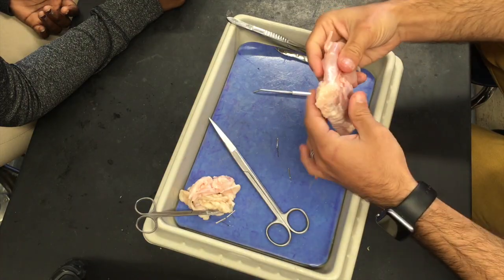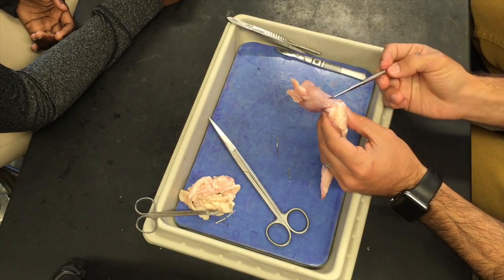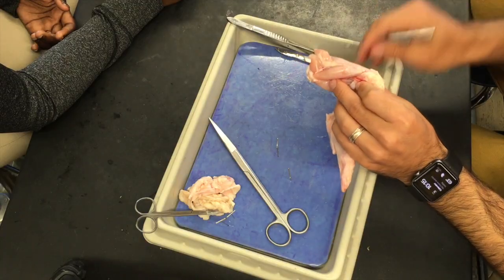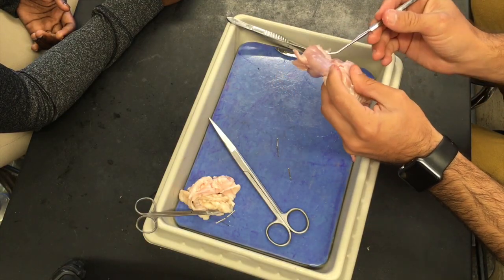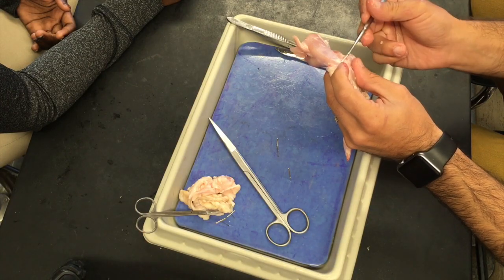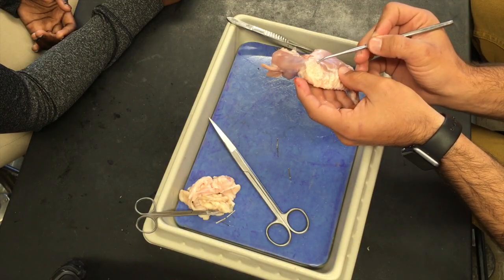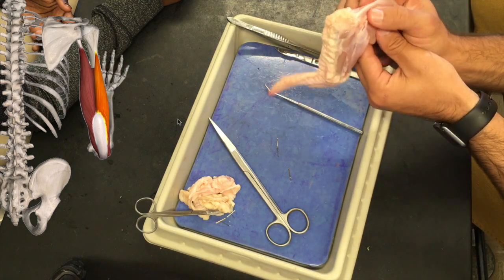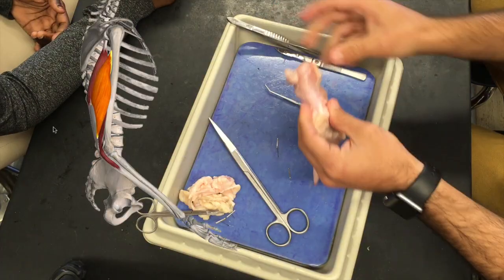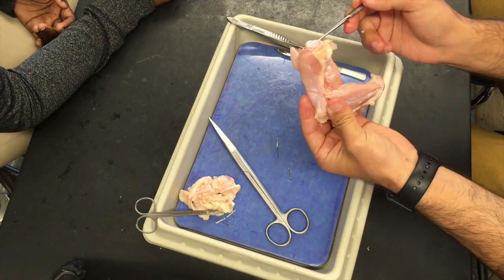Now we do the same thing on the tricep. How many muscles are in the tricep? Three. We've got one, two, and three — three muscles that are in the tricep. Now, they have tendons as well. Here's that tendon — that silvery goes to white right here. That band's going to go across this joint and connect to the bone right about there. So we pull on that, and it's going to have the opposite effect — it's going to straighten out the arm. So we've seen muscles, tendons, and cartilage.